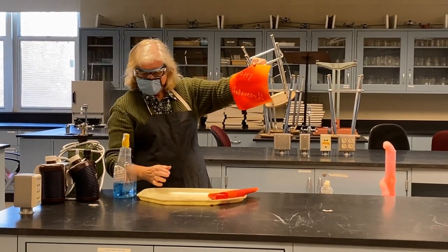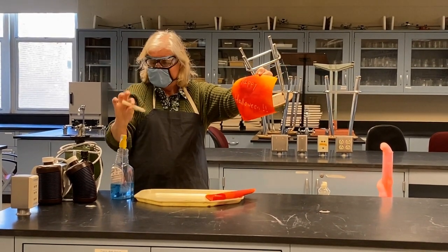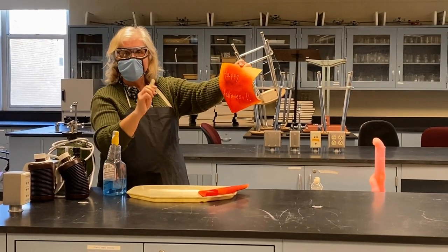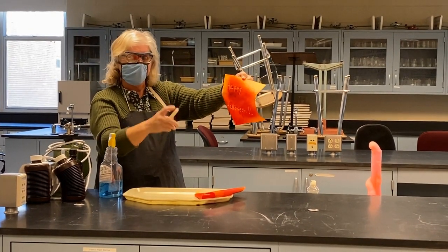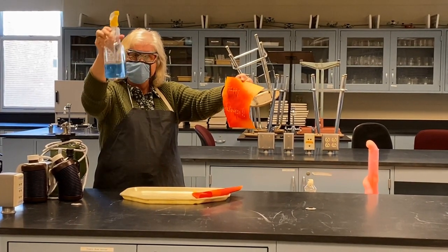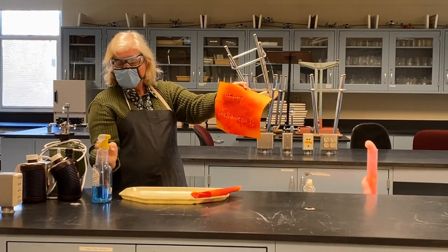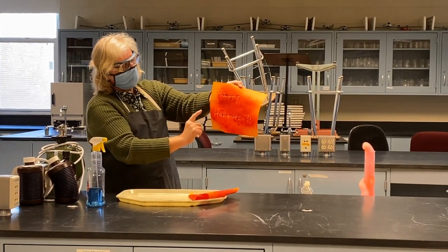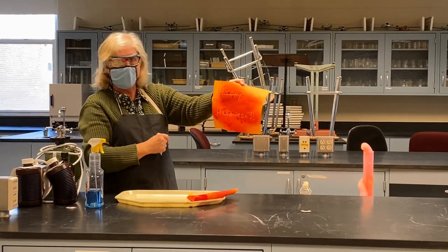Okay, so how did I do that? Well, all I did was take something that blocked the spray. I took a wax crayon and I wrote on this. Now, when you come to intermolecular forces, you're going to learn about things that are polar and things that are nonpolar. Wax is very nonpolar. Water, basic solution, is very polar. So the nonpolar wax blocks the polar water so that the spray, the ammonia spray, cannot penetrate there. And that's why I see the orange letters on the red background.